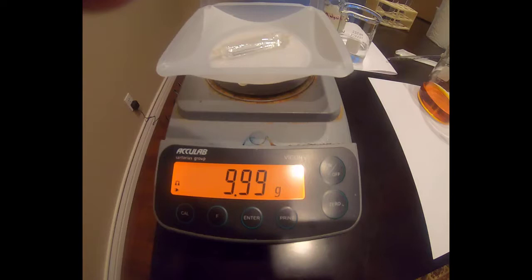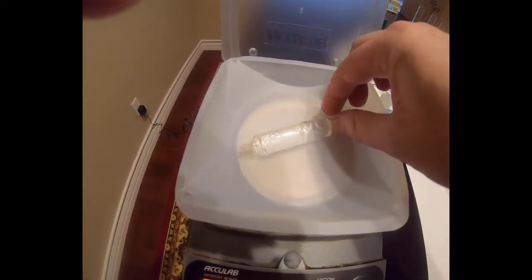We also should note here that the bag contents are clear. You should record the bag content color on table 1 of page 3 in your lab handout under initial color of bag contents for the negative control of water. I then take our control bag and place it into the control beaker.